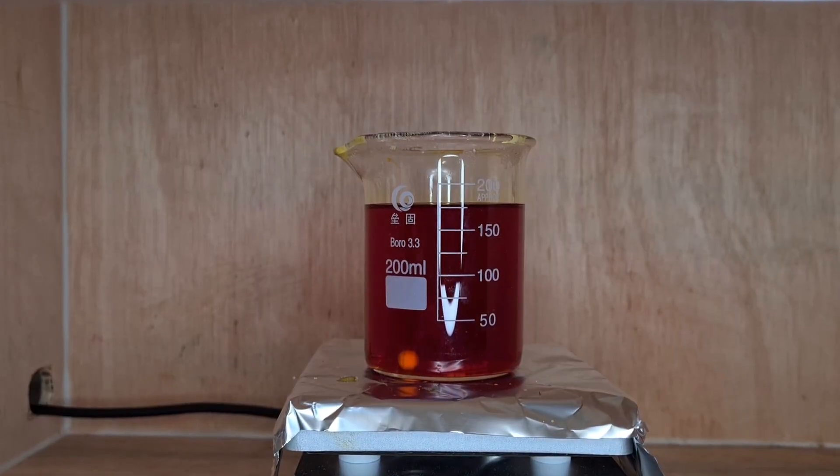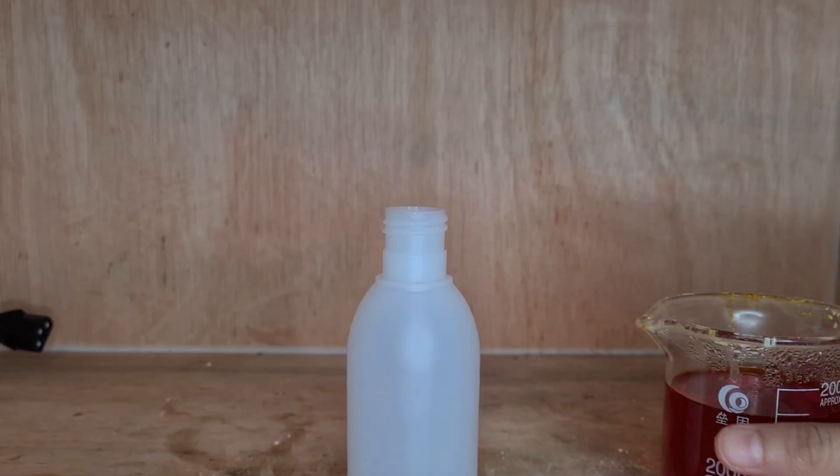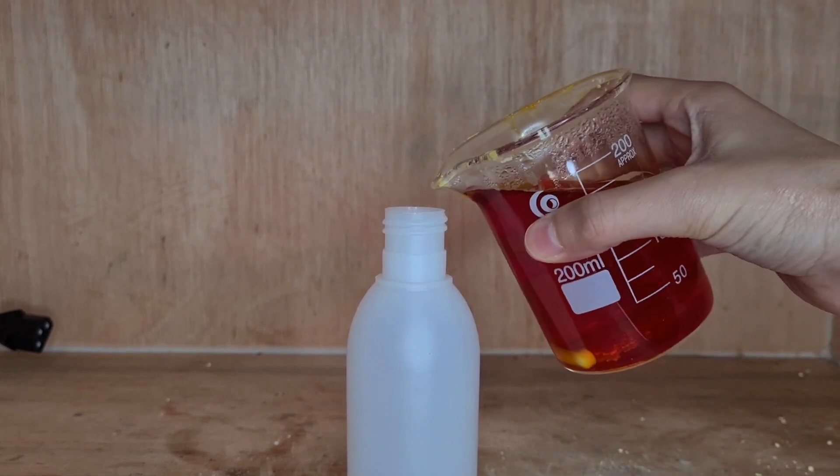When all the sulfur dissolves, we're left with this red solution. Nice. Now I'm going to transfer the sodium sulfide solution to a storage container.